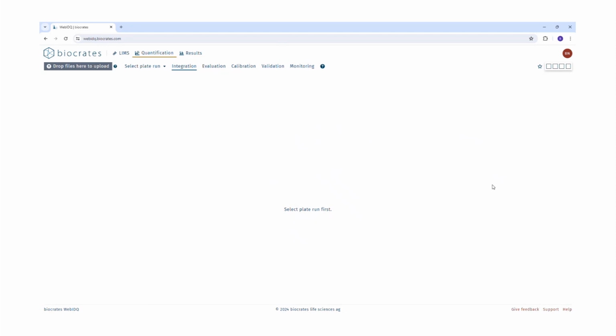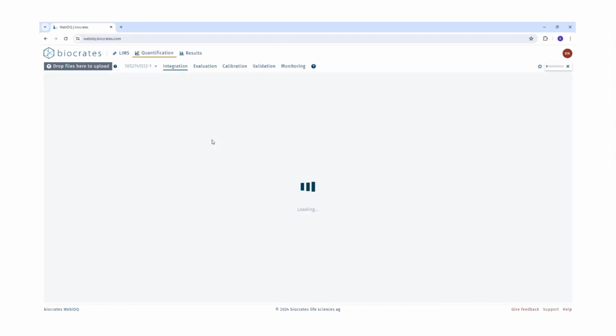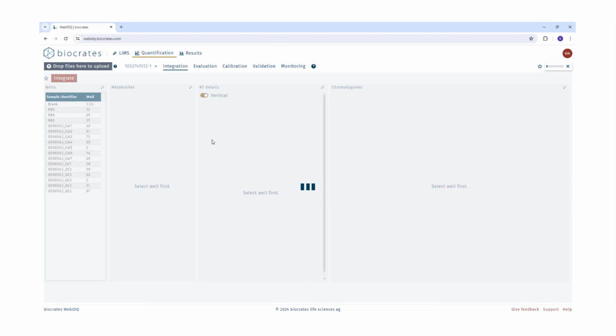Here we will be discussing little tips, tricks and magic which will be helpful for the peak integration, specifically for LC Kit data. If the data has not been previously uploaded to WebIDQ, open the Windows File Explorer and navigate to the folder containing the Kit MS data. Select the Kit MS data and drop it anywhere in the WebIDQ window. It can take up to a few seconds to upload the data into the database.